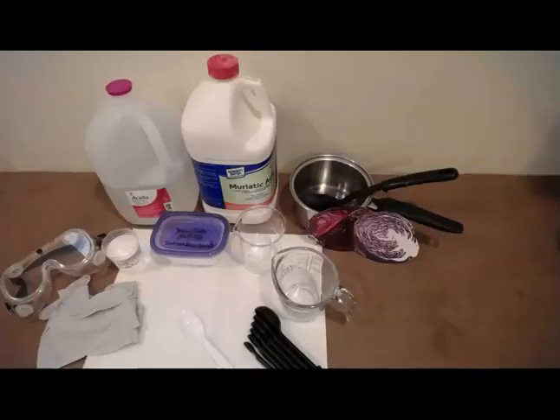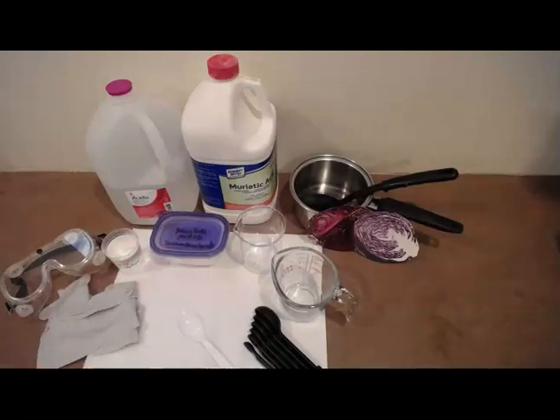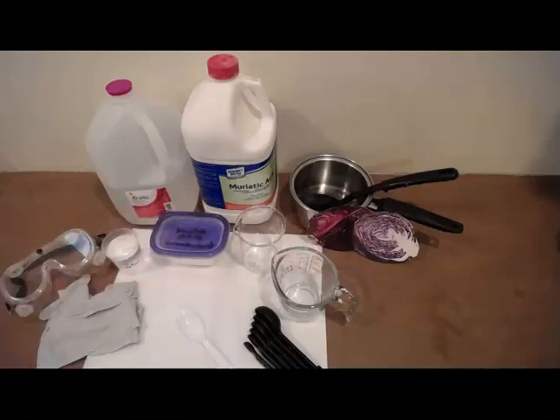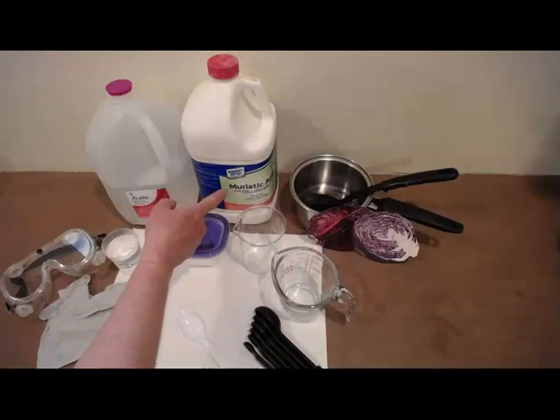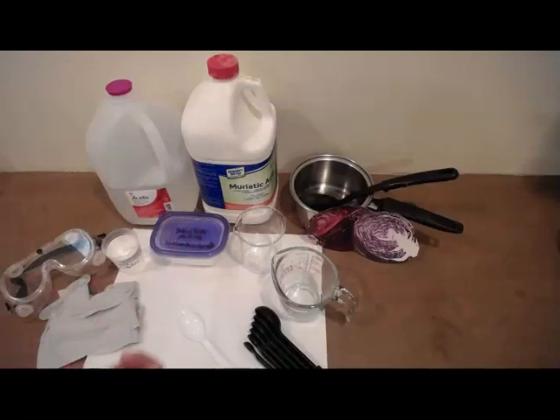The equipment and materials in this experiment are as follows. We have baking soda, so sodium bicarbonate, and the toilet bowl cleaner, like The Works, the same kind that we used in the previous experiment. But again, if you can't find that, you can use that solution that you safely made with the muriatic acid available in a hardware store, along with water. So again, that's 5 milliliters or a teaspoon of this muriatic acid added to 1 liter of water.